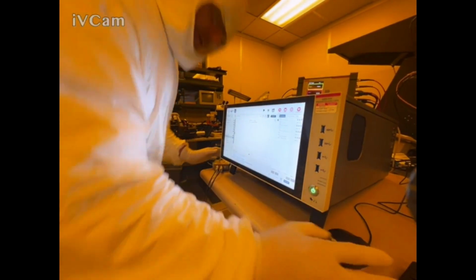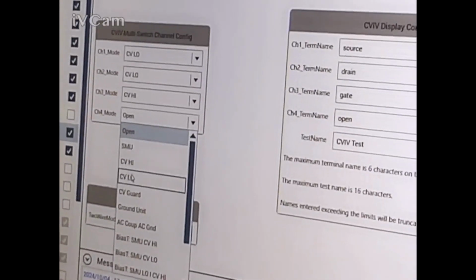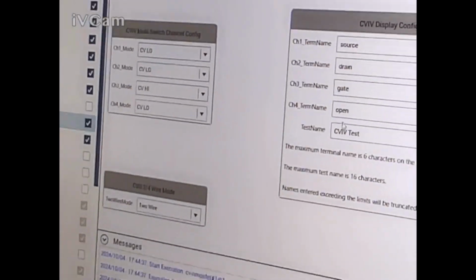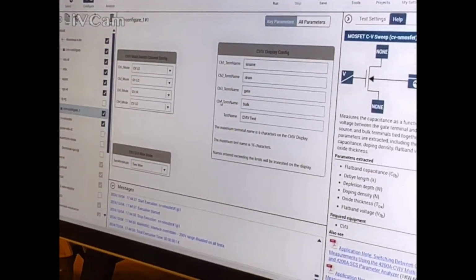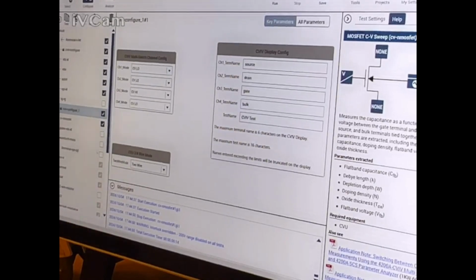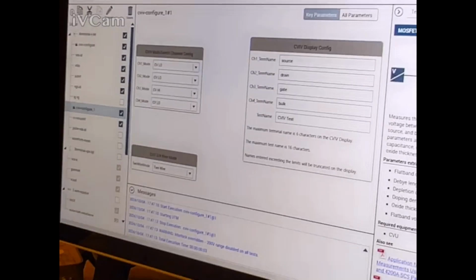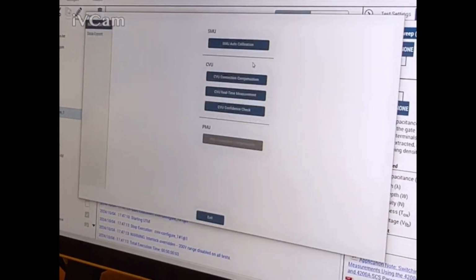Okay, so first thing I'm going to do is go back to the CVIV configure, and I'm going to make channel 4 CV low. Channel 4 is open, right? My bulk, so we're going to call that bulk. Okay, so that's my bulk. And let's run that. So I got CV low, CV low, CV low, CV high. Okay, now let's hit back. It ran the configure.